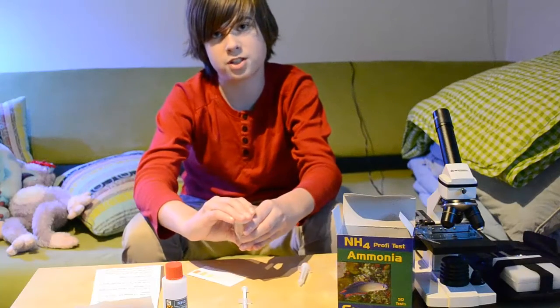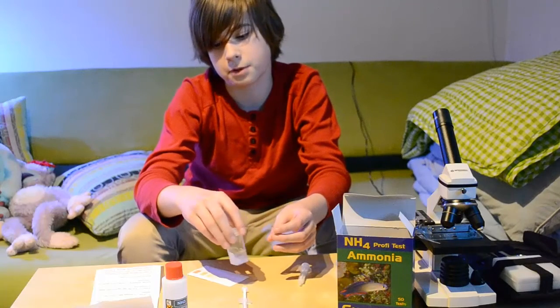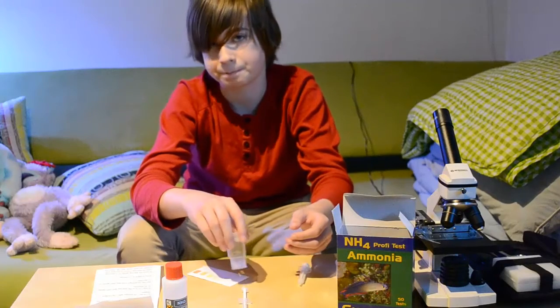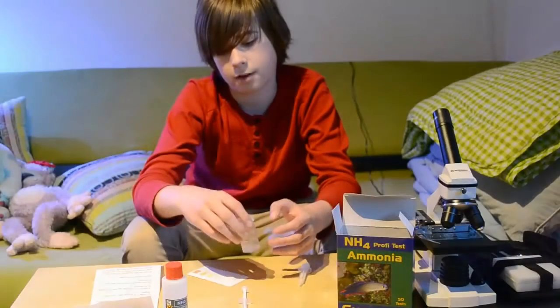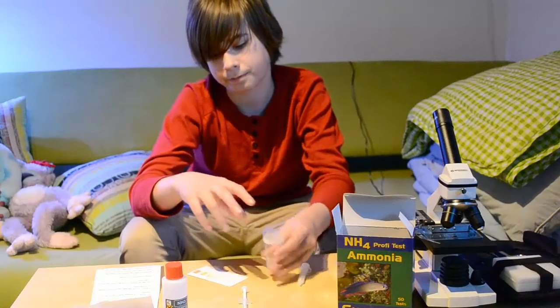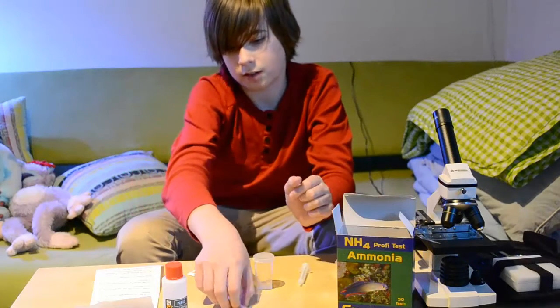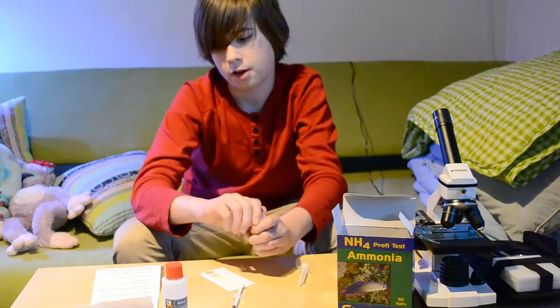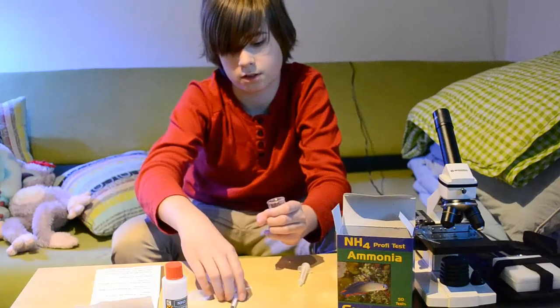You don't want to be shaking it vigorously. You want to gently swirl it around, because shaking it the other way gives more inaccurate readings, which is not a good thing. Do this for about 30 seconds. Then you want to add the rest of the milliliters into the bottle and shake it for about 10 to 15 seconds.